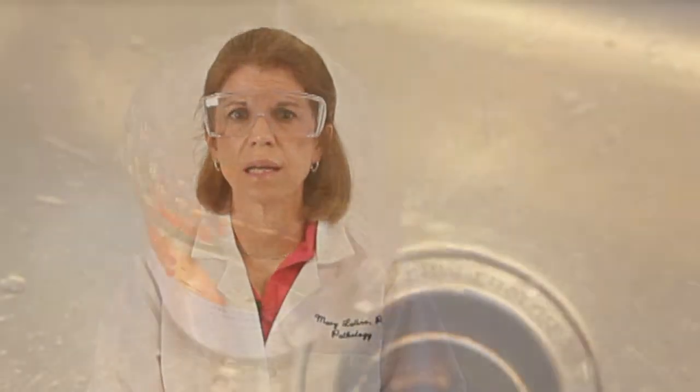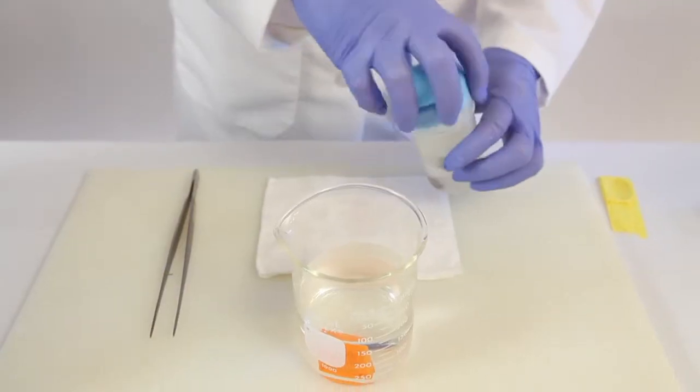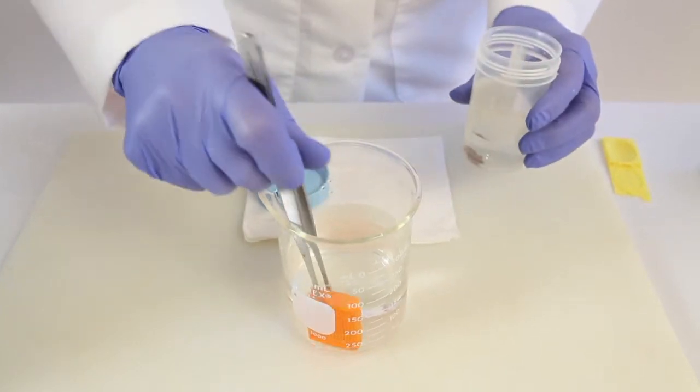So be careful, and as soon as your bone core is ready, rinse it again in running water for 5 to 10 minutes. Then put it back in the fixative until you're ready for tissue processing and staining.